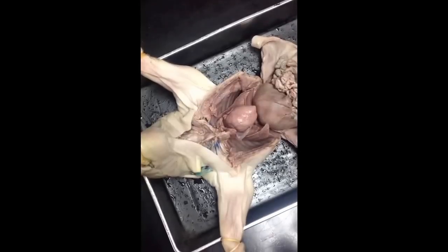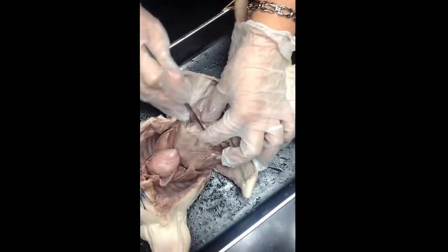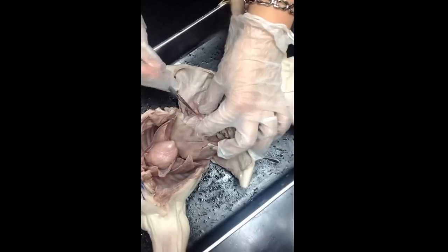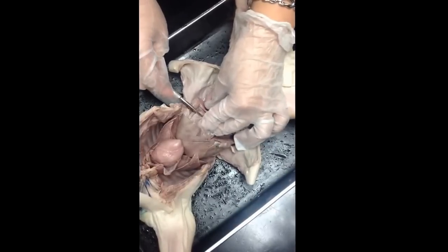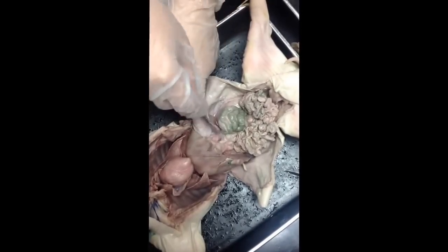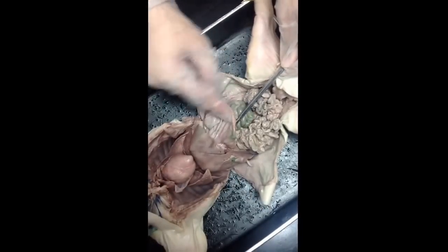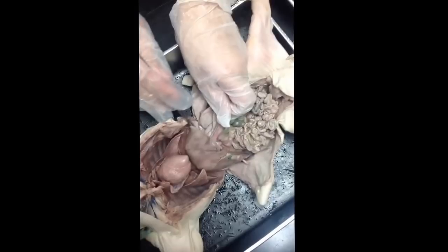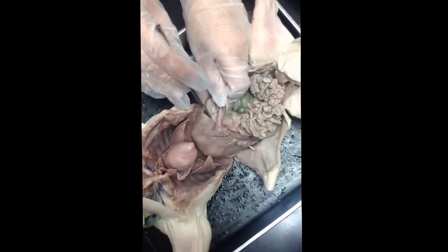Okay, what else is on your list? Hepatic. Oh, hepatic. Okay, this pig doesn't have a very pretty one. Sometimes you have to sacrifice the pancreas, so I'll be careful with this one. Sometimes you see it as blue, but in this case it didn't color. There's a tube. They'll eventually lead up, it's kind of hard to see by camera, towards the liver. And so you have to imagine that in this segment with all this connective tissue, there are blood vessels in here. So if I ask you to identify this blood vessel that's going into the liver, hepatic portal.